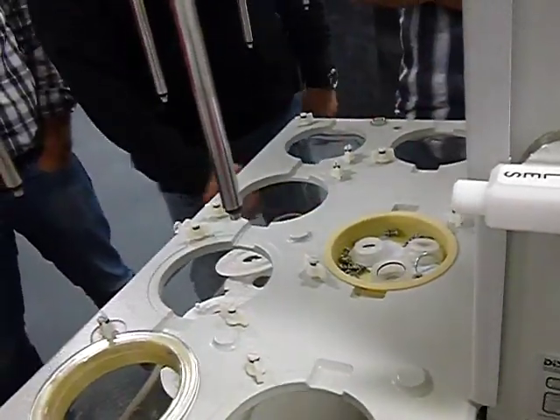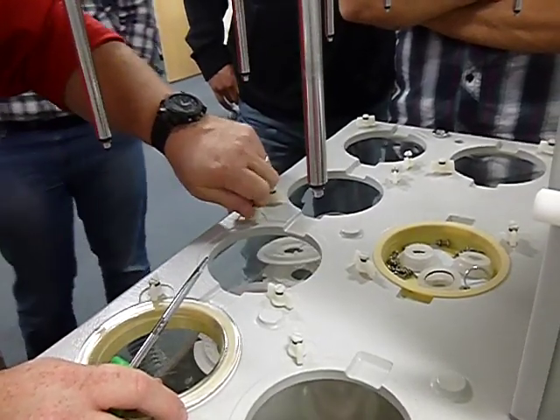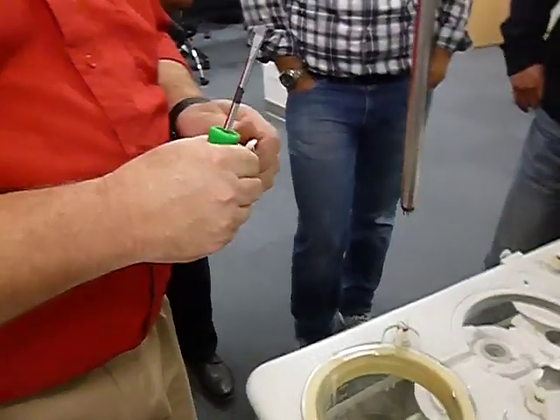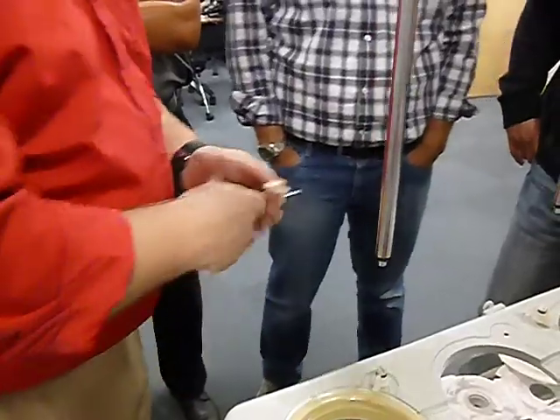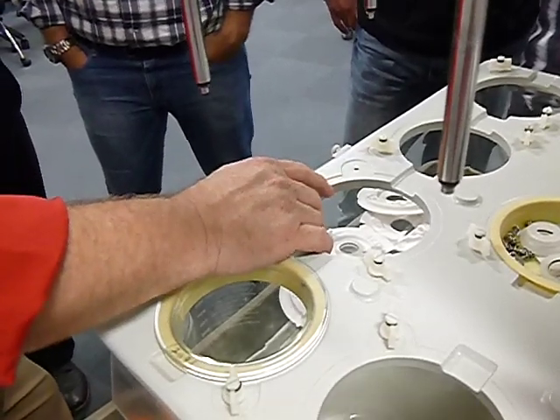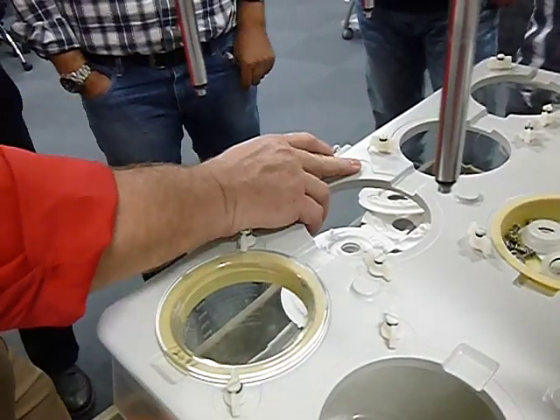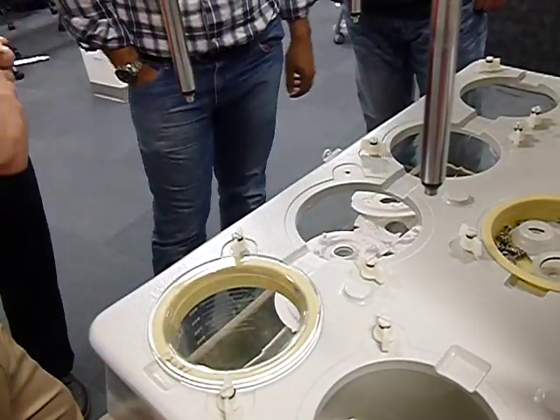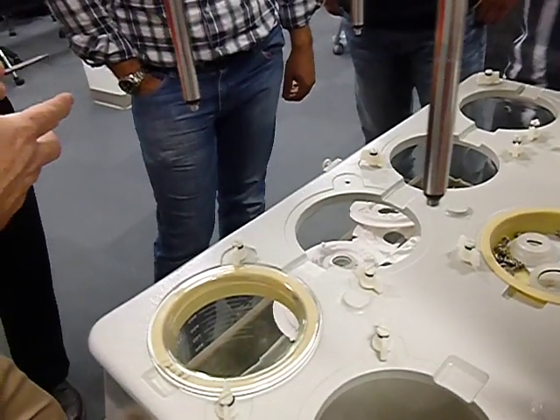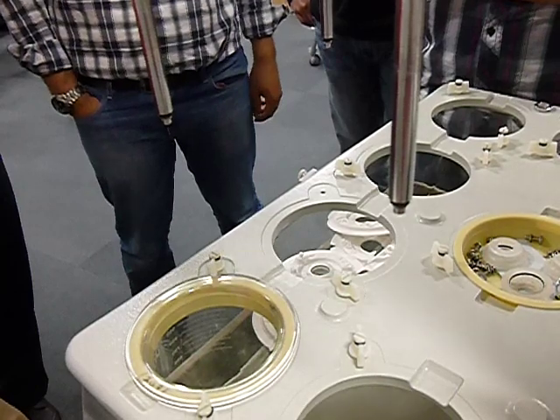If any of these are snapped off, as I said before, one of the things that I tend to do if one of these is broken off, you can drill these out. If there's a broken piece inside there, you can drill them out. I've always found in the past, 15 years of doing this, that drilling it out, you take a risk on elongating the hole itself. Whenever you're using metal on metal, you're going to hit some of those teeth inside there, the threads, and you're actually going to damage the threads to where it elongates the hole. Once you elongate the hole, because this is plastic, it's going to be loose in there forever. It's never going to get tight again.